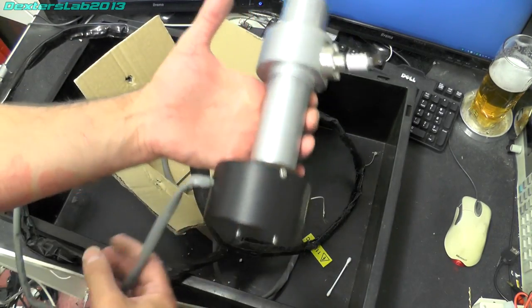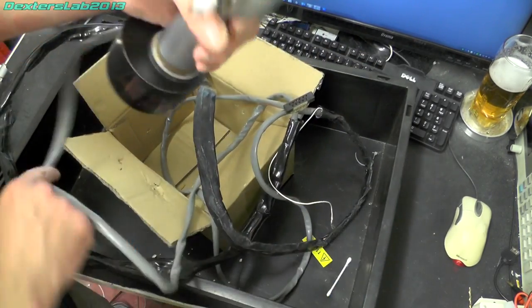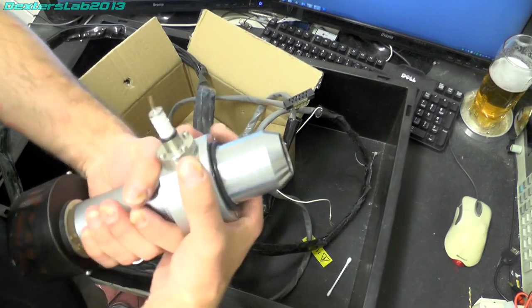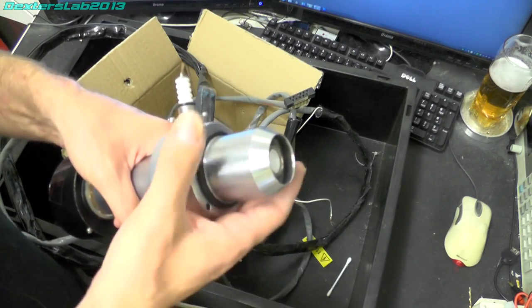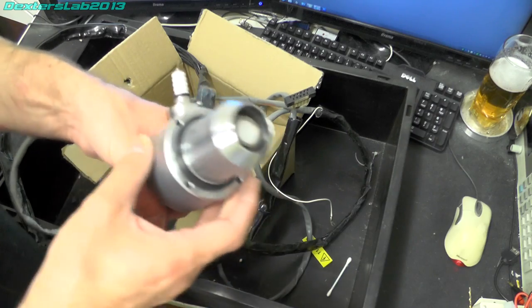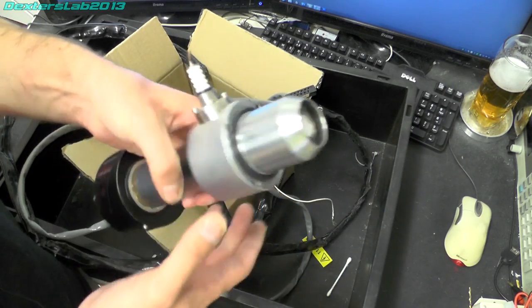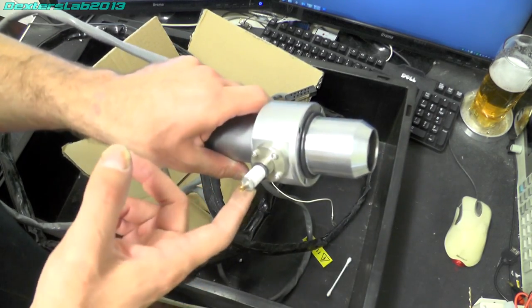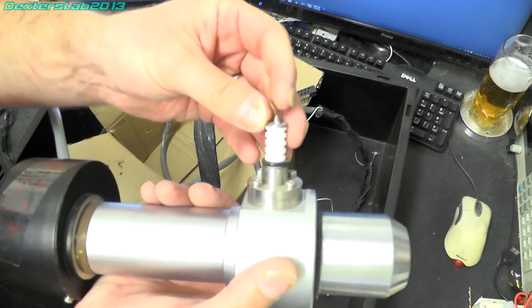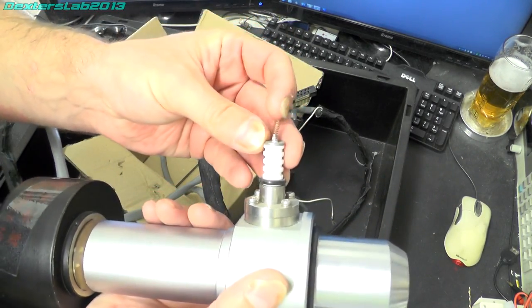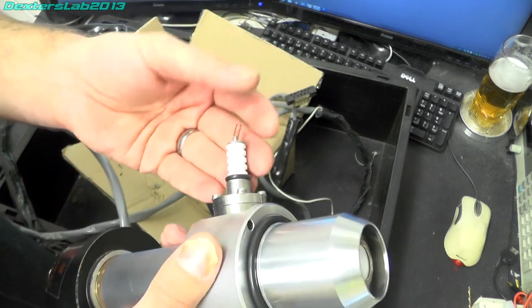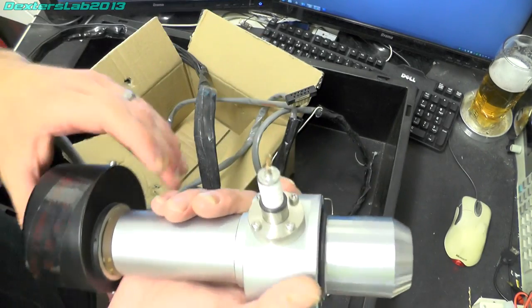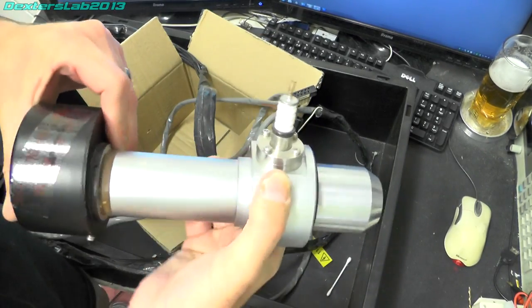And this item here with all the long wires on. I'm again corrected on this that apparently this is the secondary electron detector. It's got a flat front and there's a high voltage connection on the front on the top here. Now it does look like something has been broken off there. That was like that when we took possession of it.